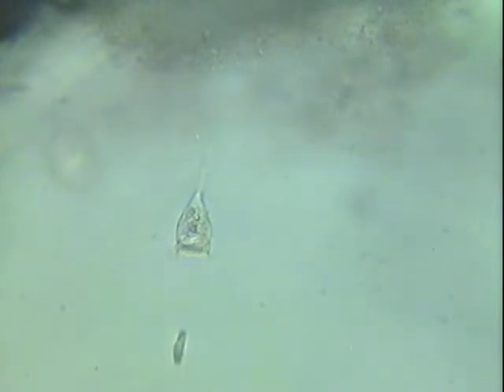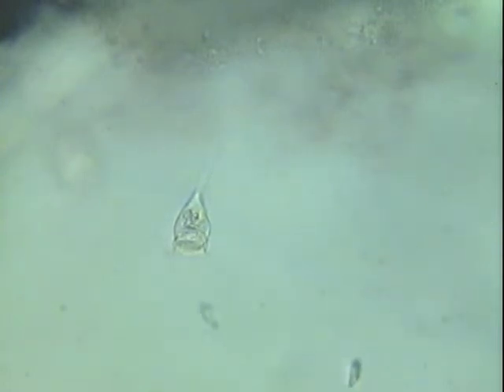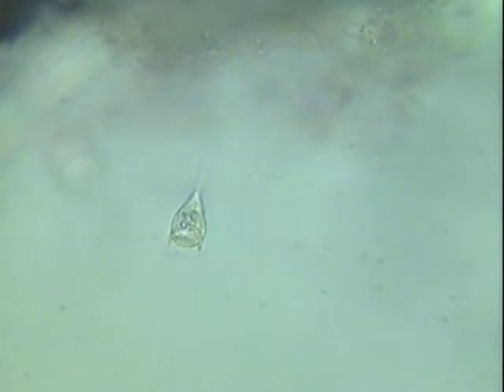However, it gets its food by pulling in material. Watch — see how stuff goes zooming by and gets pulled in. Right at the very tip are little hairs, and they're waving back and forth creating a vortex, or whirlpool, that pulls food from the outside world into it through an opening at the top. This is one of the reasons it's called a vorticella — because of the vortex it makes.